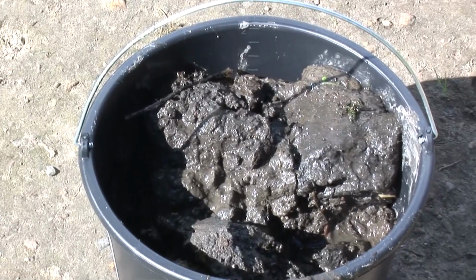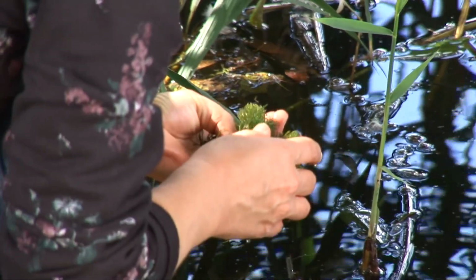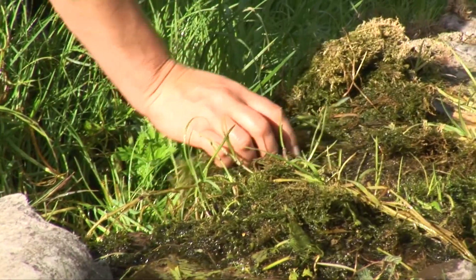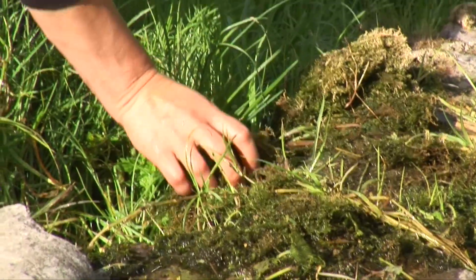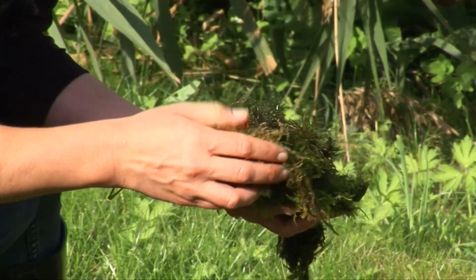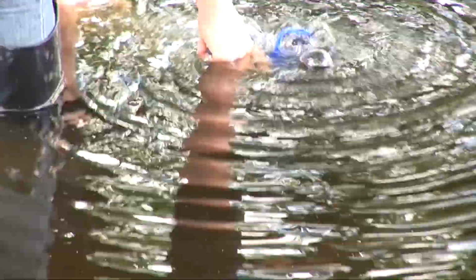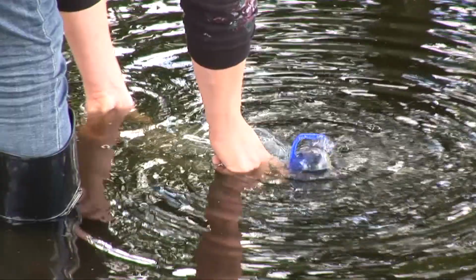So this is our environment. They're from the same location. They're from the same location because we want to cultivate the microorganisms from a specific place. So we could perhaps think of this like a portrait of a location. So step one is get some mud and water. We're going to bring the mud and water back here to our workshop venue.